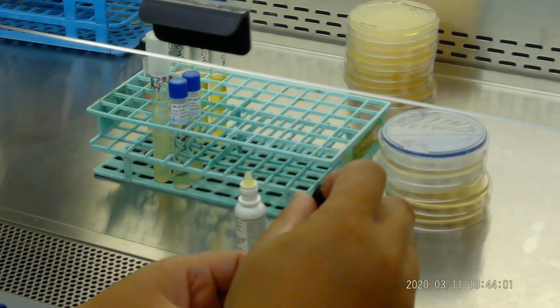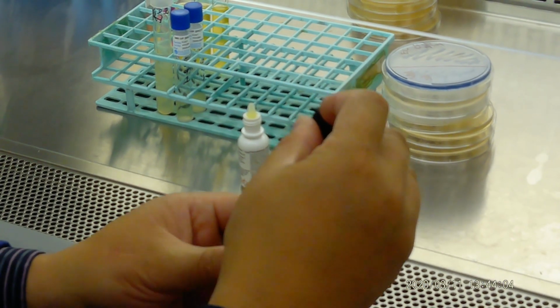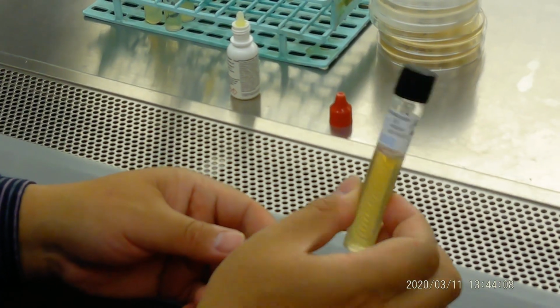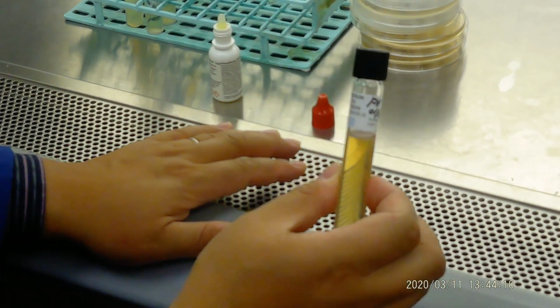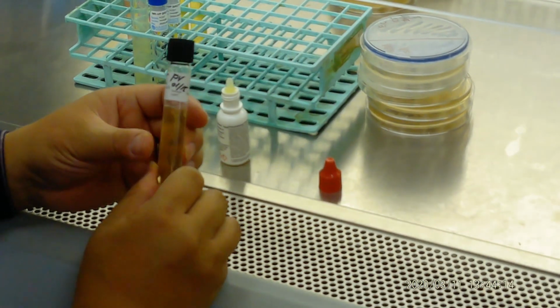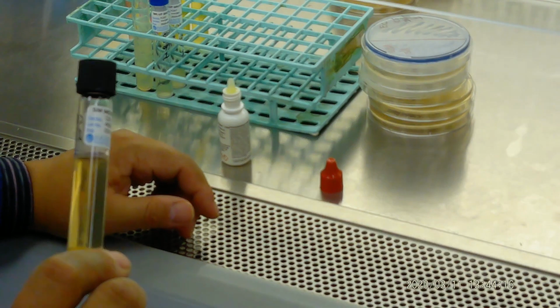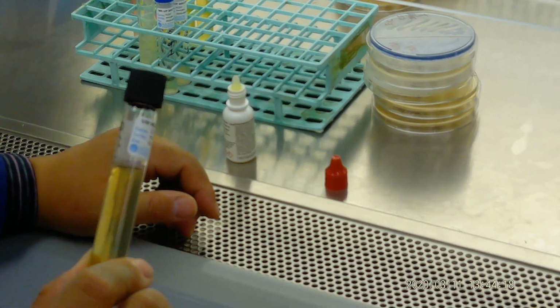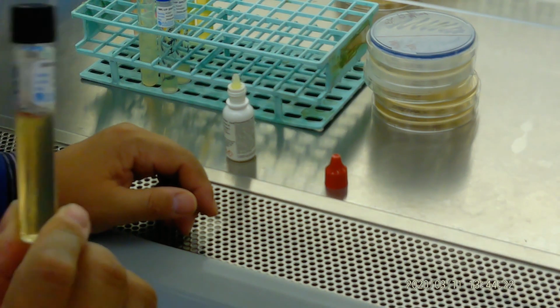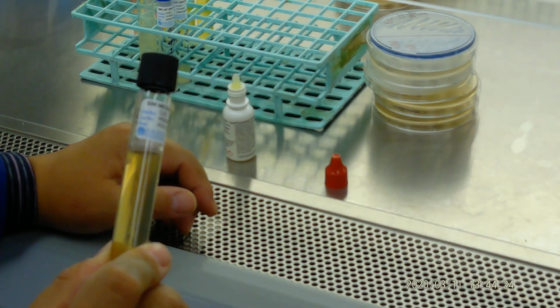We also see it's red, but actually that's not correct. This means this Pseudomonas aeruginosa, this Proteus vulgaris, might be contaminated, so we don't know the reason for that. Okay, you can take a picture right here. We didn't see much of the color.